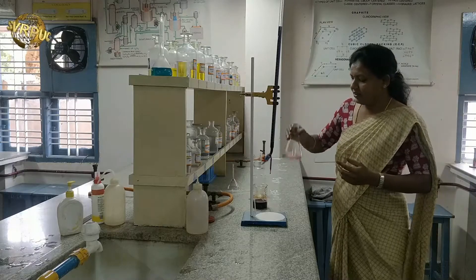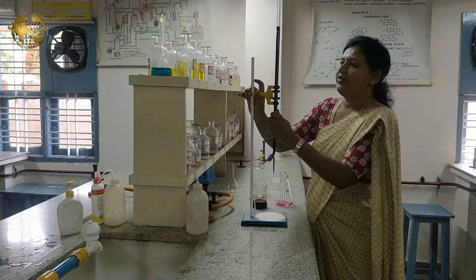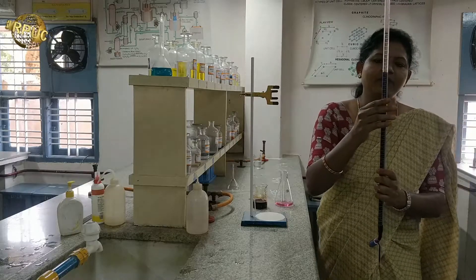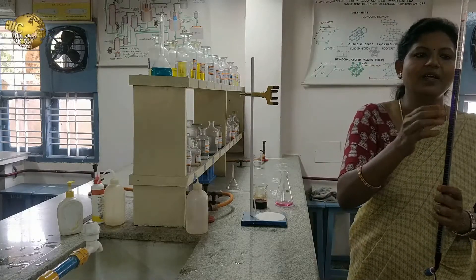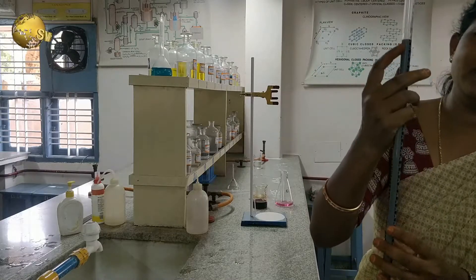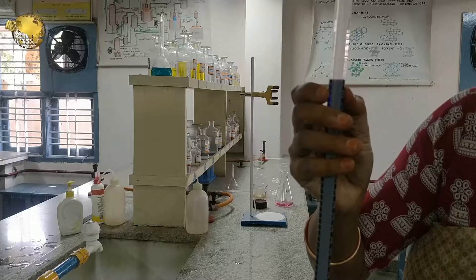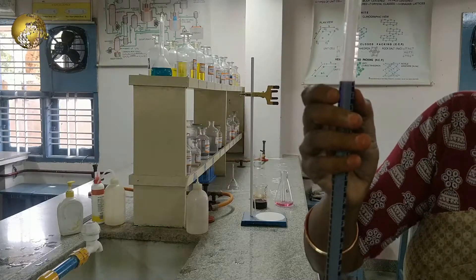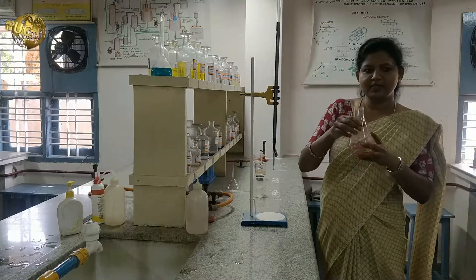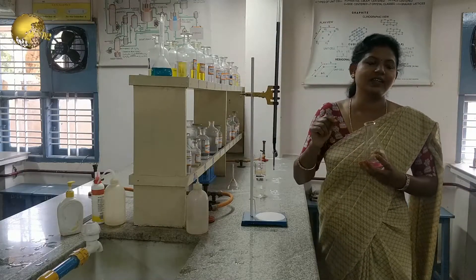After reaching the endpoint, we take the burette reading. While taking the burette reading, we take the upper meniscus of the solution because this is a colored solution. Here you can see the burette reading is 9.4 ml. Whatever end point burette reading we have taken is called the final reading.